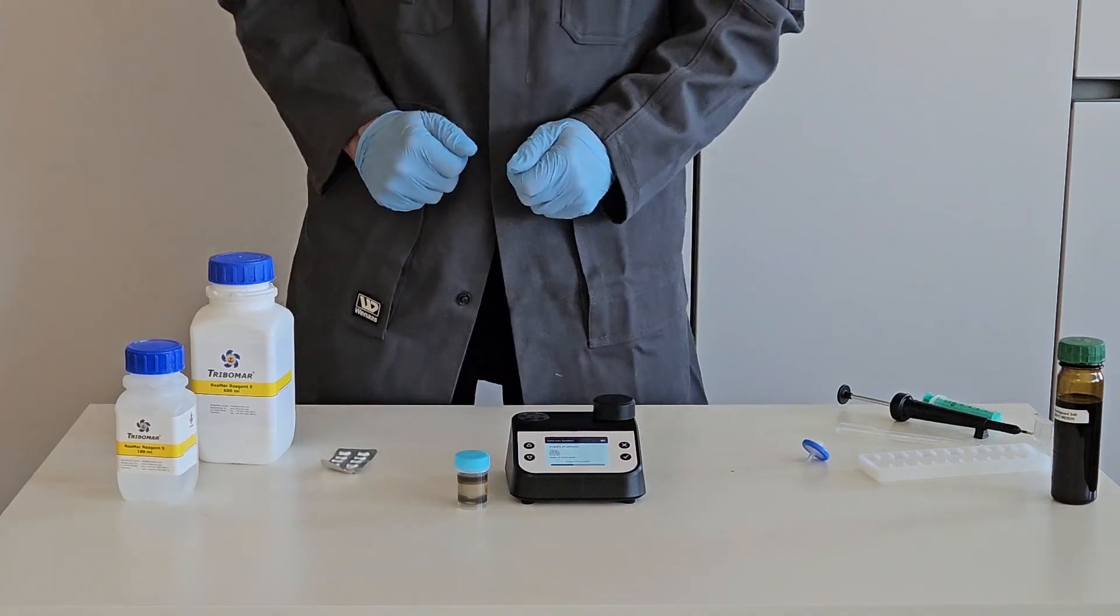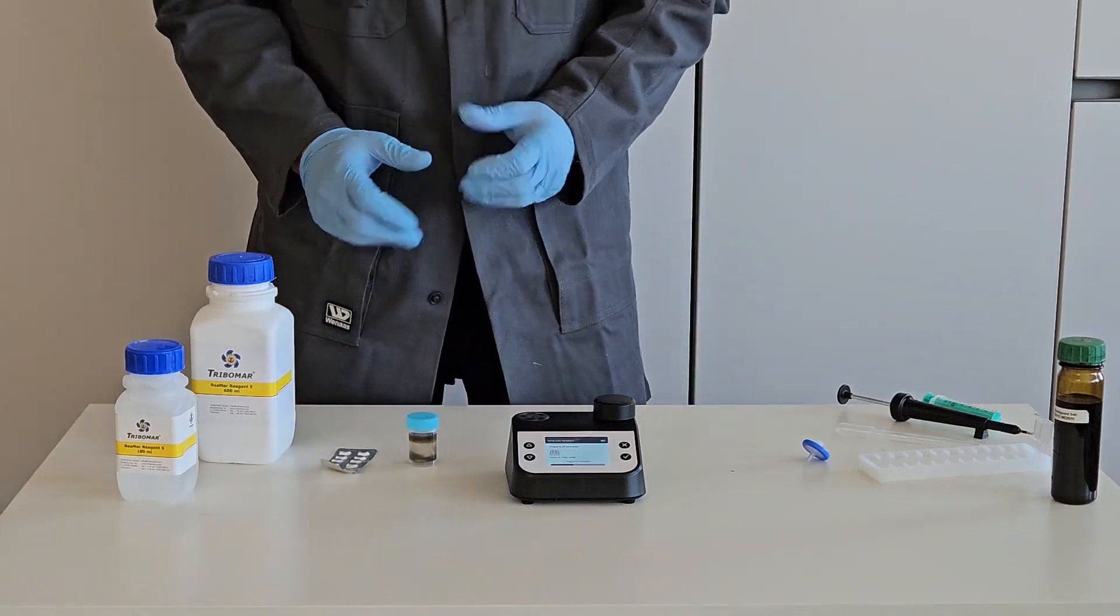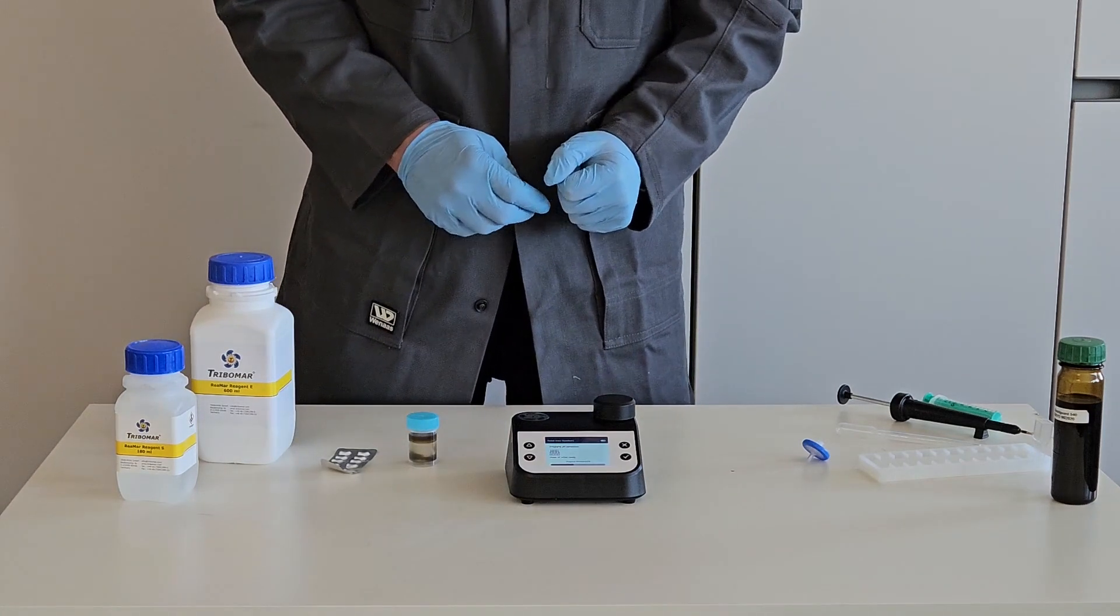The display now shows to prepare the samples. This we did already. Pressing OK button starts timer of 100 seconds shaking period.